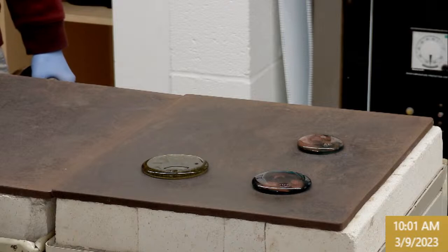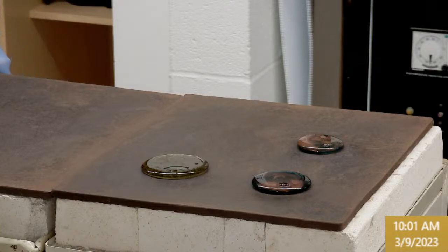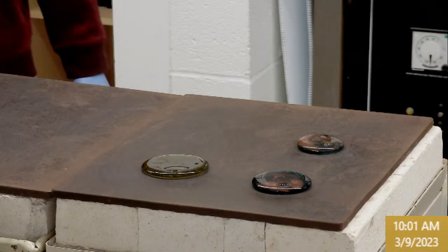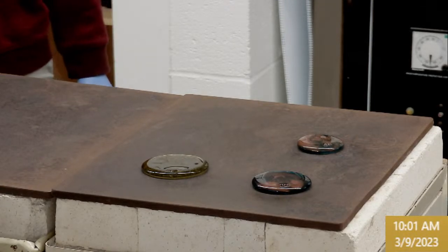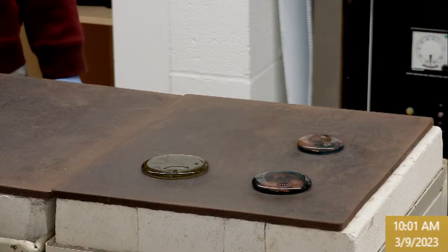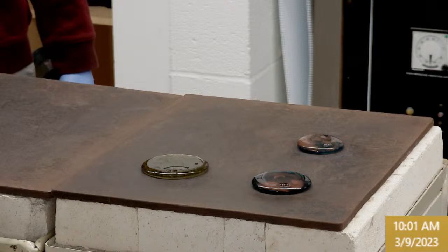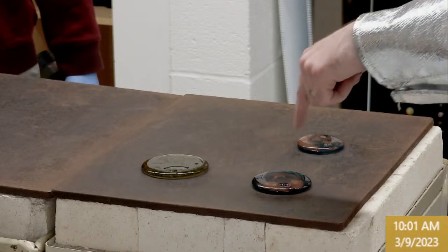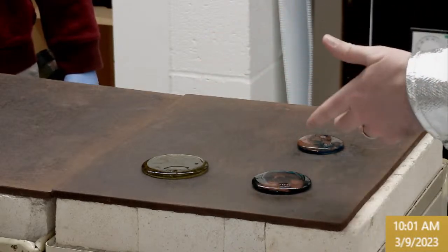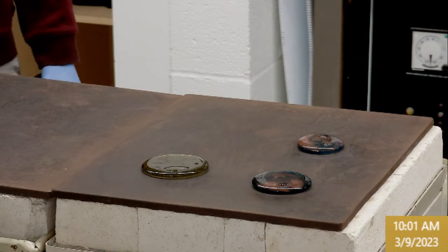All right, 3N. Yeah, 3N is next. Let me think about that quick. Yeah, maybe it's just because I'm starting to get used to seeing some borate containing glass. That one was a little bit tighter than the others, but this was medium borate, high borate, no borate. That tells a pretty clear story that borate's playing a major role in that viscosity for this set.